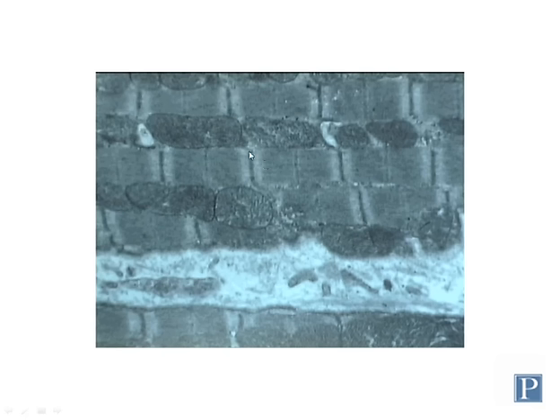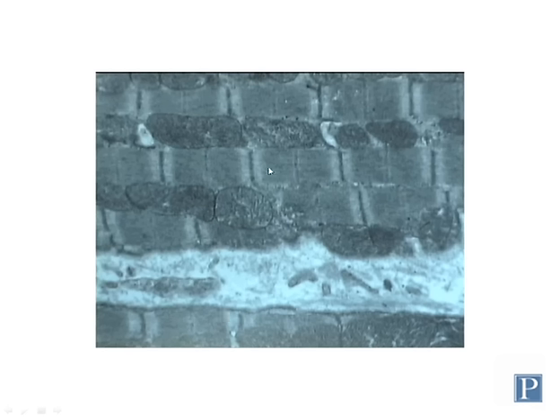You can see some other structures, such as these dark lines in the middle of the I bands, so the color is not completely uniform, but when you look at it with a light microscope, because of the alternation of the A bands and I bands, you just see it as giving it a simply striated appearance.